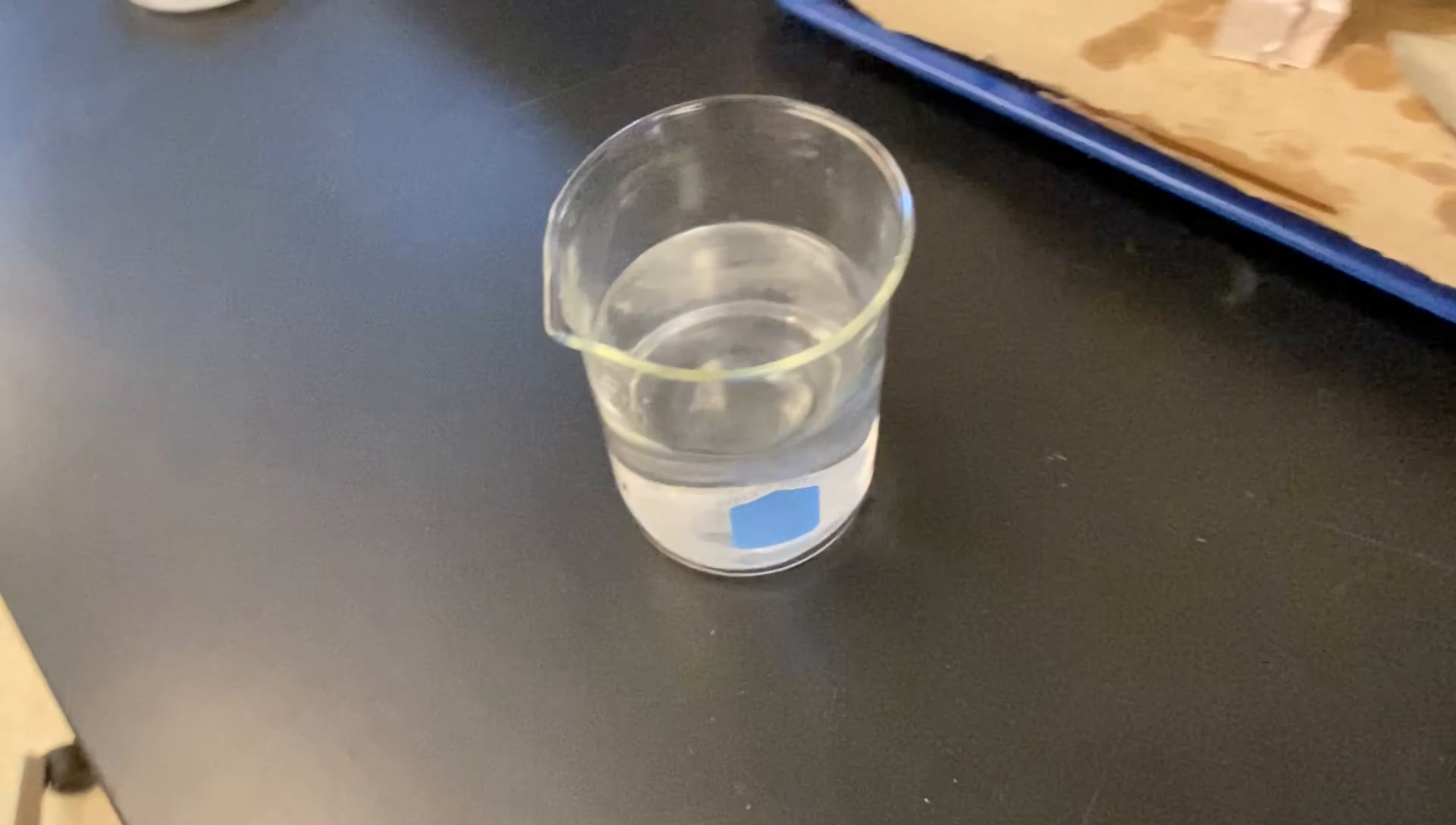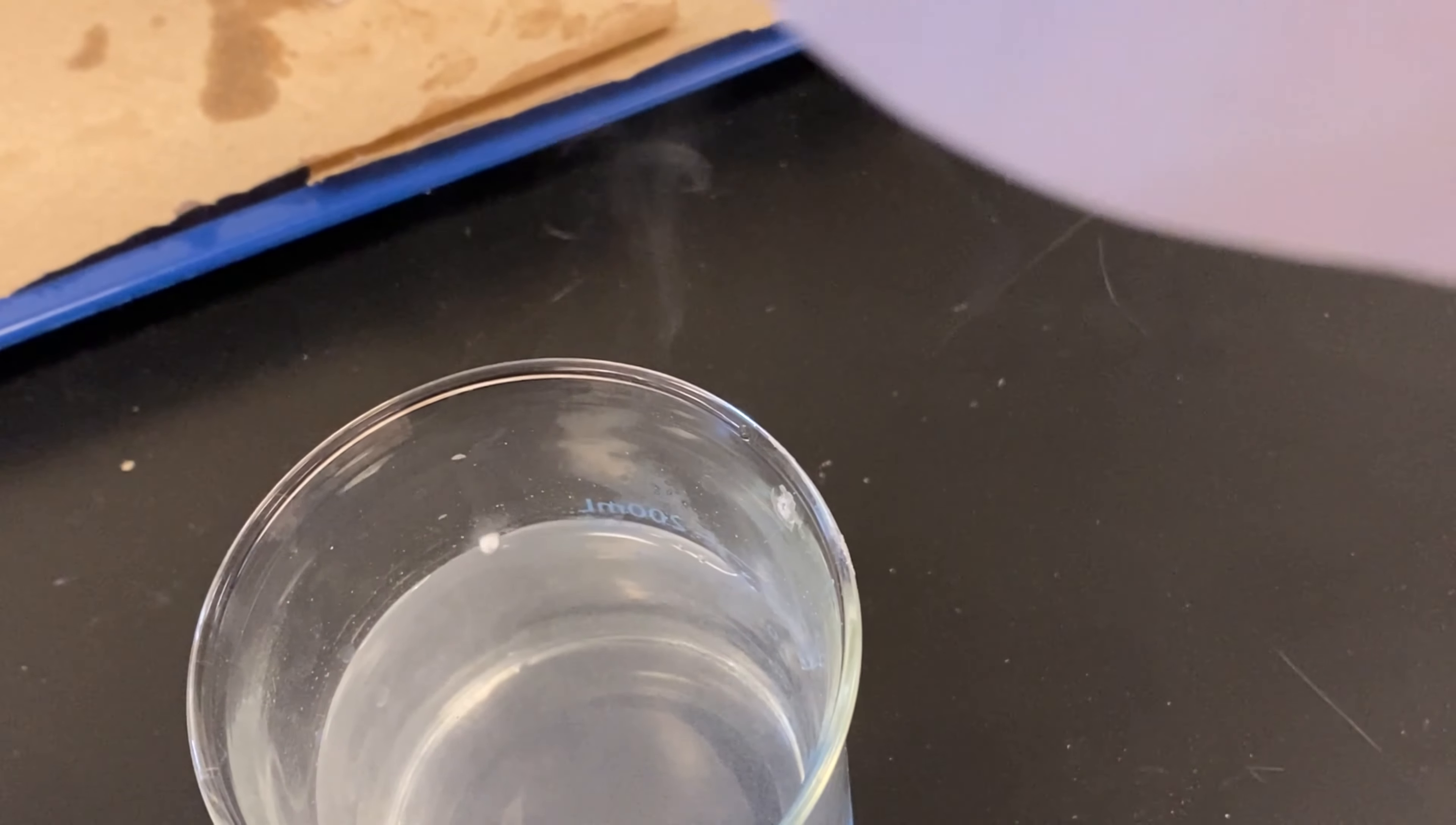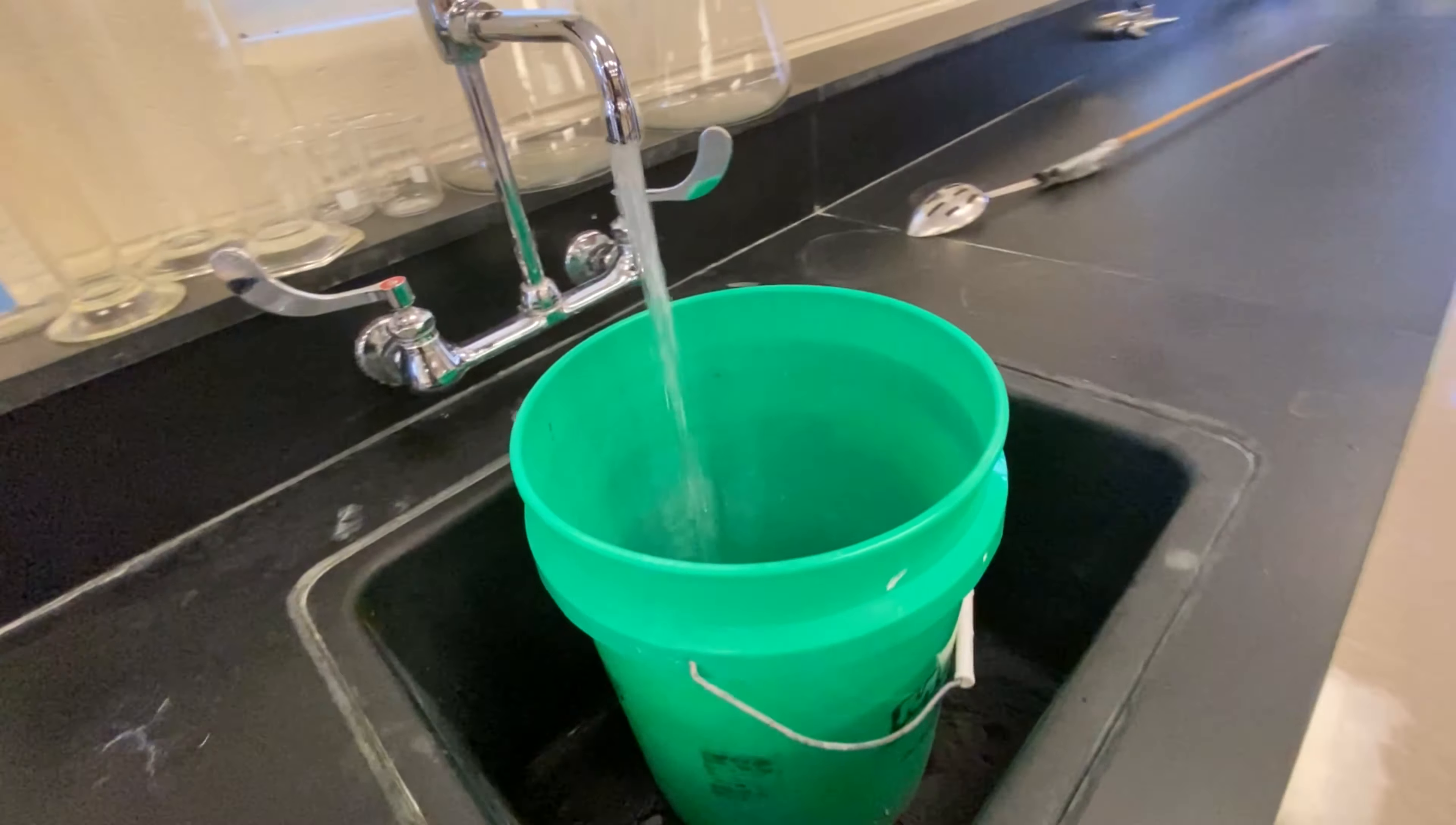And this one's a little bigger, so don't be surprised if we get some popping on this one. Okay, there you go. It's kind of scooting around on the surface of the water. It's not playing nice with the water right now. We're getting some of that white powder being generated. It kind of leaves a wake behind it as it shoots around on the surface of the water. It's trying to get away from the water. We've got some sort of smoke being released into the air here, and now it's gone. See, our water's starting to get cloudy with that white powder there. All right. Now, this is fun, but I want to take you outside and show you what this looks like on a bigger scale. Let's get some water.